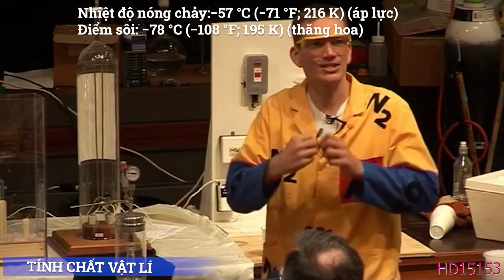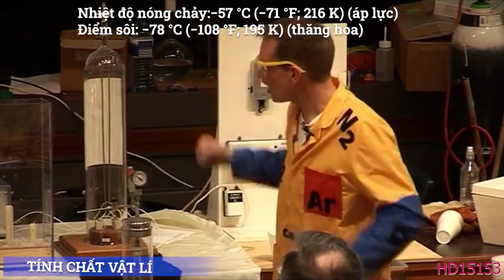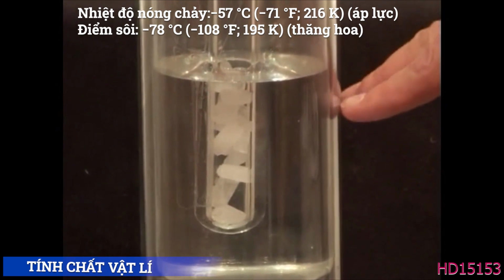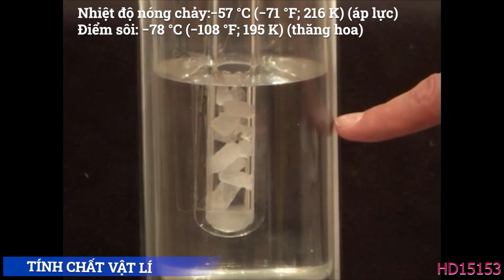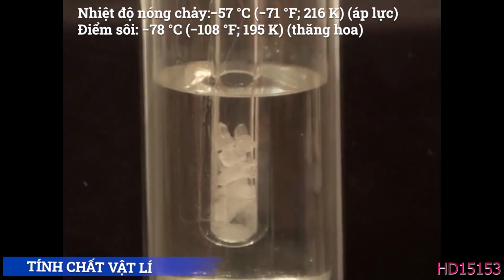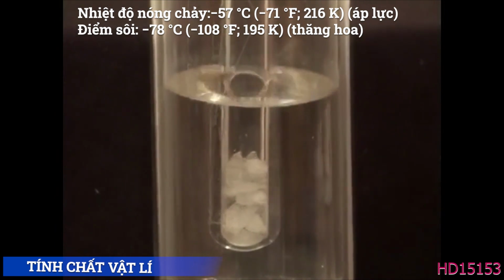So the gas takes up much more space than the solid, and as the solid turns into the gas, with nowhere to go, the pressure is building up, building up, building up. Well, this would be very dangerous, but there is a valve to let some out later. But look what's happening down the bottom here. As the pressure builds up, look what's happening to the solid carbon dioxide. It's melting. So we can get, there we are, liquid carbon dioxide. It's now forming liquid carbon dioxide, and there it is in the bottom of the test tube. Okay. It's melted to give me some liquid in there.